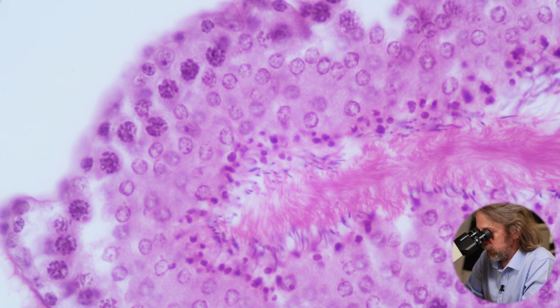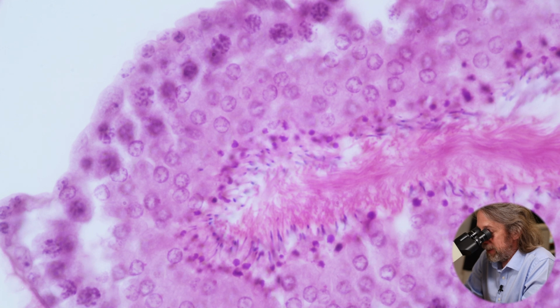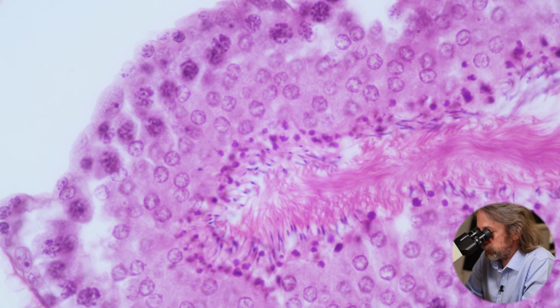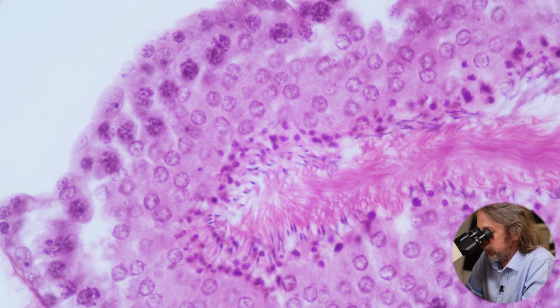Then as we move to the right even further again, as we get closer to the lumen, we can see how those cells have become much smaller. They're much smaller, darker patches of nuclear material. So the cell has become condensed, the cells are becoming spermatids. And then as we go to the right again, that nuclear material has become even more compacted, and they're becoming late-stage spermatids and then spermatozoa. And we can see those spermatozoa in the lumen. We can see those long strands of their flagellae all mixed together.